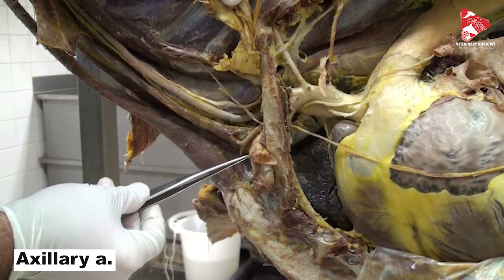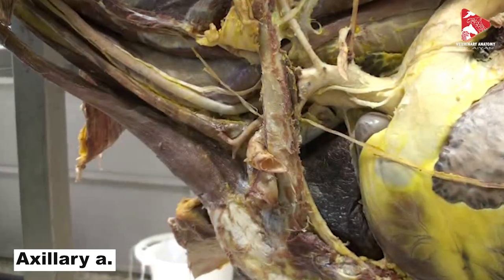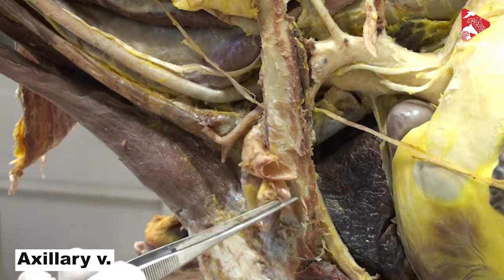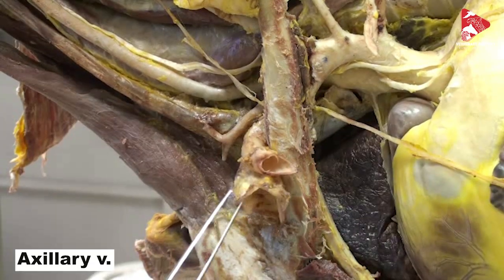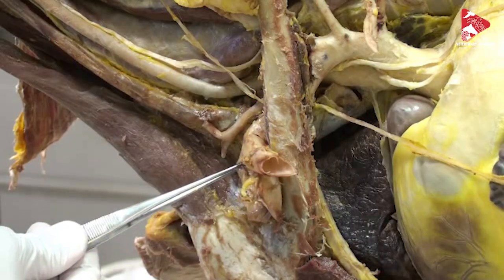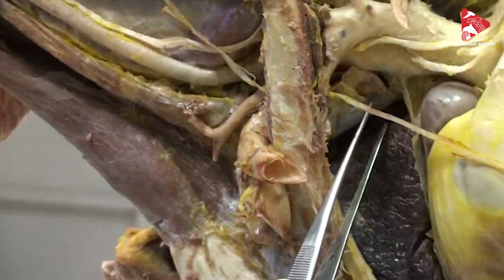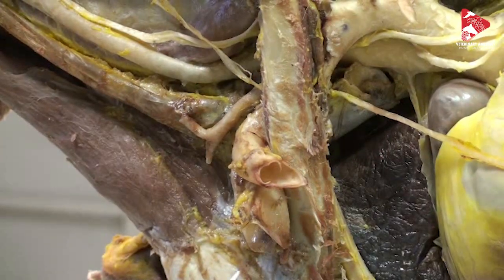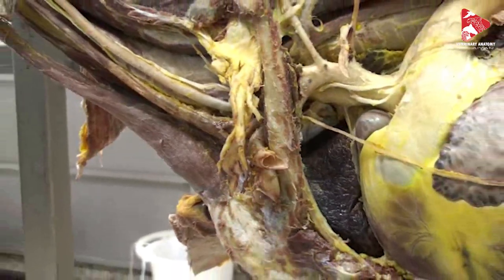After giving the internal thoracic artery, the left subclavian artery leaves in front of the first rib and continues as the axillary artery — this big one here. Next to the axillary artery there is the axillary vein, a large vessel with a thin wall. Both the axillary artery and vein move to the left forelimb. The axillary vein collects blood from the forelimb and meets the external jugular vein to form the brachiocephalic vein, which continues as the cranial vena cava to the right atrium.